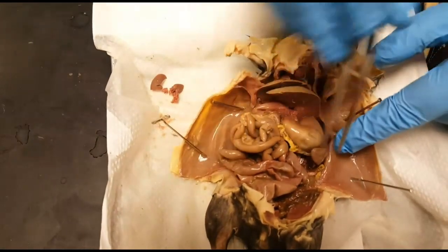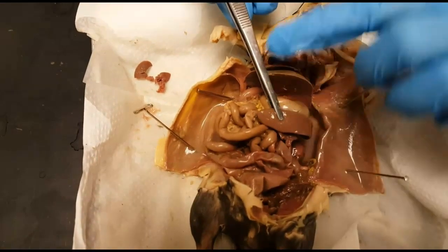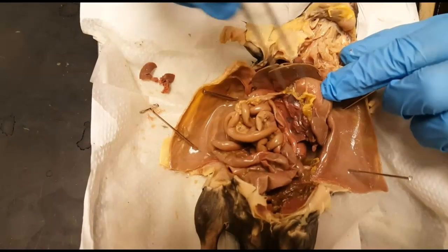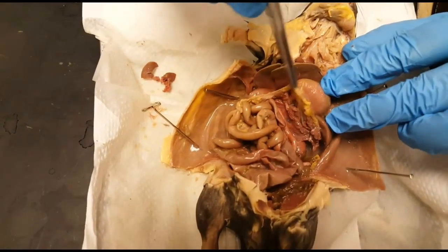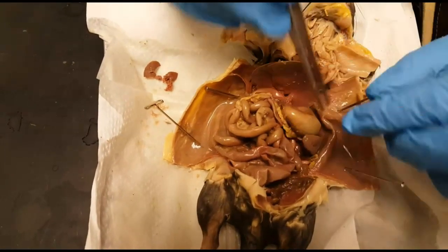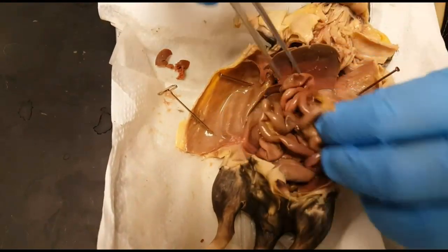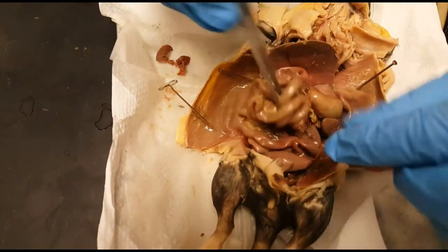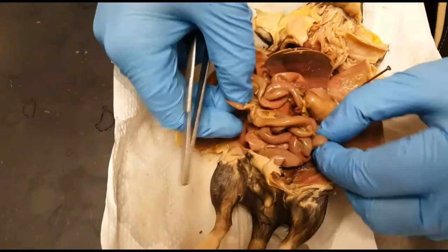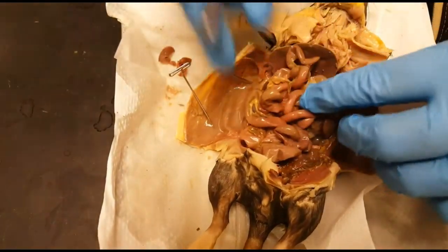On the side of the stomach we have an organ called the spleen, attached to the stomach via the gastrosplenic ligament. Here we have a little piece of tissue called the pancreas. Here once again is the duodenum, and the second part of the small intestine called the jejunum. You can see the mesentery with the mesenteric arteries inside holding it all together.